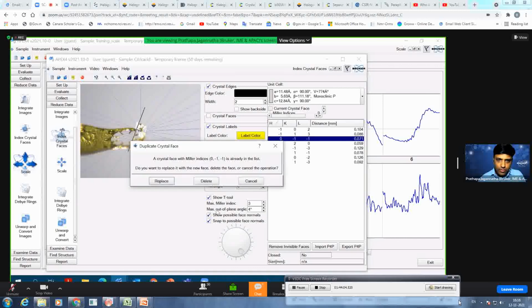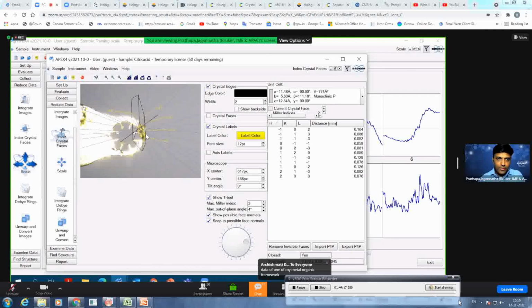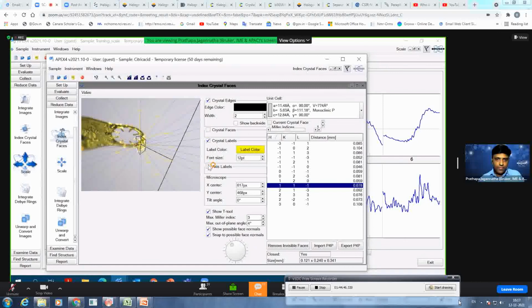I'm still not able to get out. Replace. Okay, I'm just getting one random size. Not so awkward. You can do it very patiently and very slowly and very closely looking at your crystal. Okay, so this is just an example. Removing faces, I have removed the wrongly assigned face, so you get the proper size of your crystal. Once you do this, I think you can just move on to your scaling here. It should be overwritten to your P4P file.